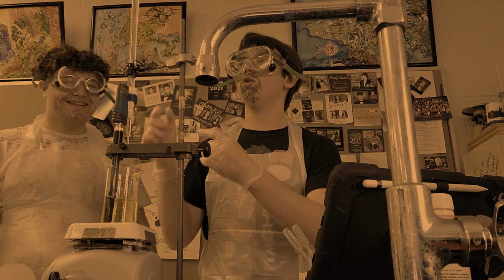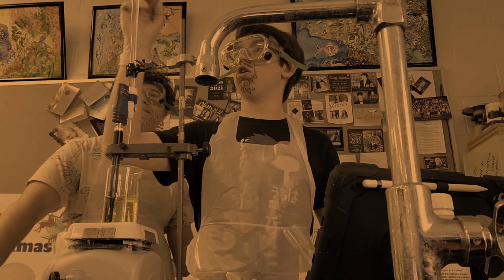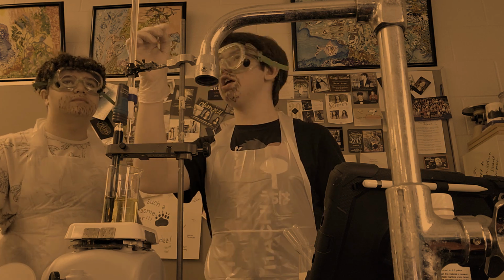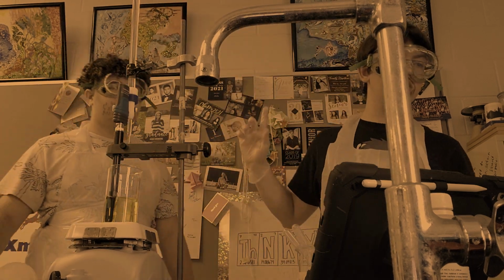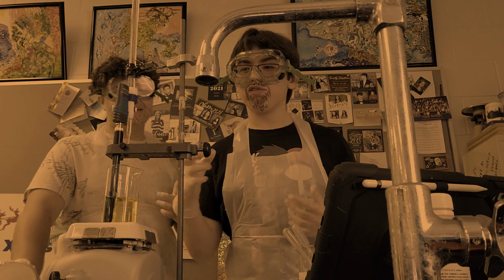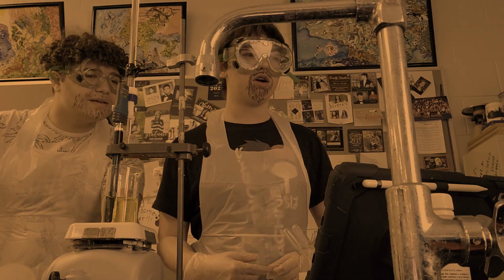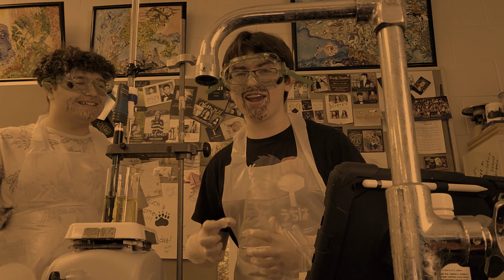Pinkman. Okay, so if we take a look here at our burette, we've dripped 18 milliliters into the beaker. 18 milliliters? You know what that reminds me of? 18 millimeters. That reminds me of our 3/4 equivalence point. But here's the thing: at 3/4 equivalence point, what's our pH supposed to be? 5. Wrong, Jesse. It's 8.8.